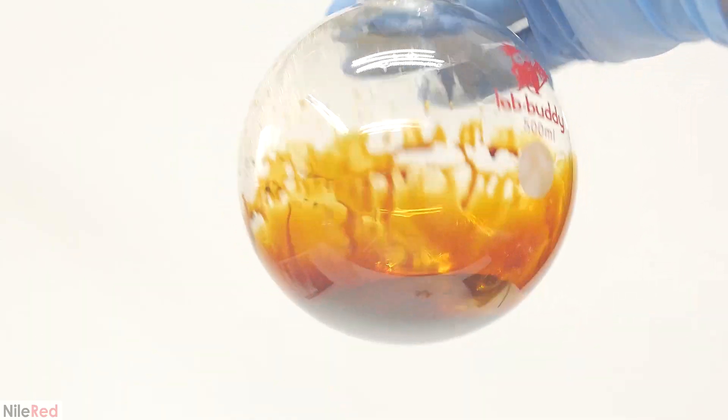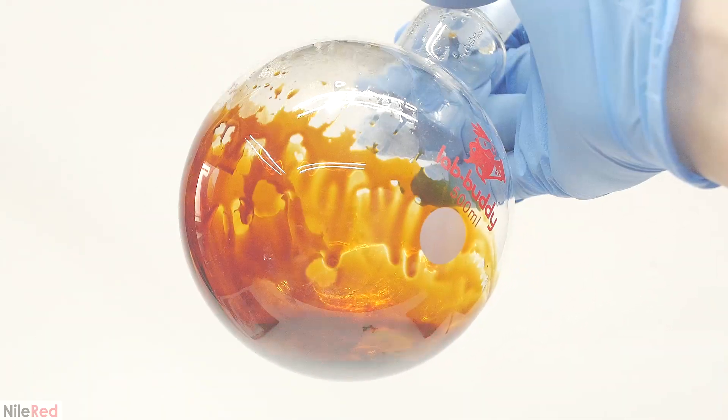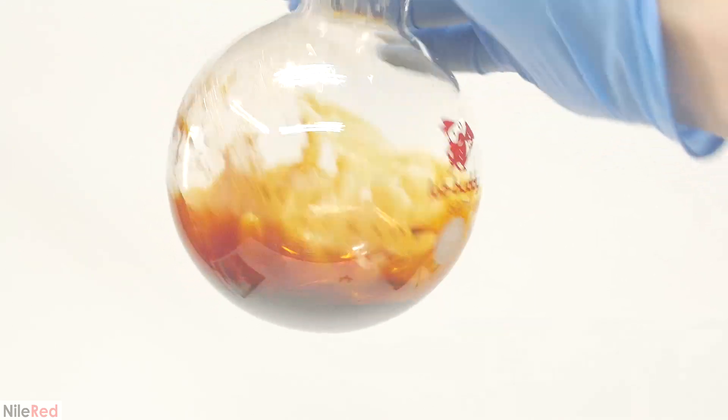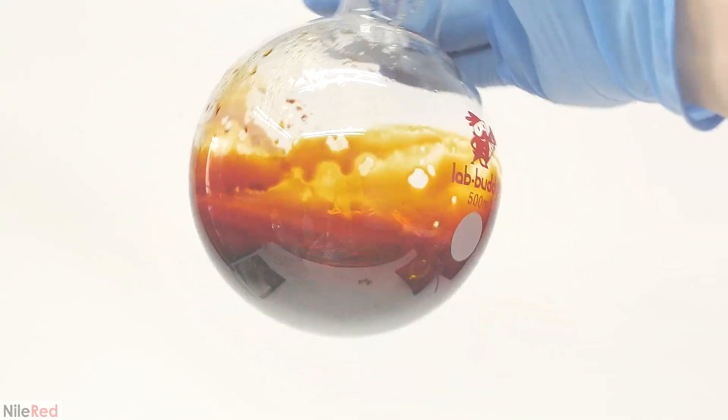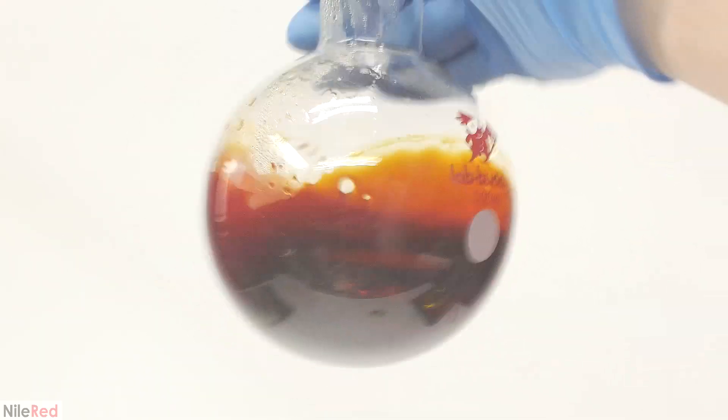So, this is what was left, a little bit of aniline mixed in with a whole bunch of polymerized junk. Because aniline is relatively toxic, this needs to be dealt with properly, and added to a waste container, and not poured down the drain.